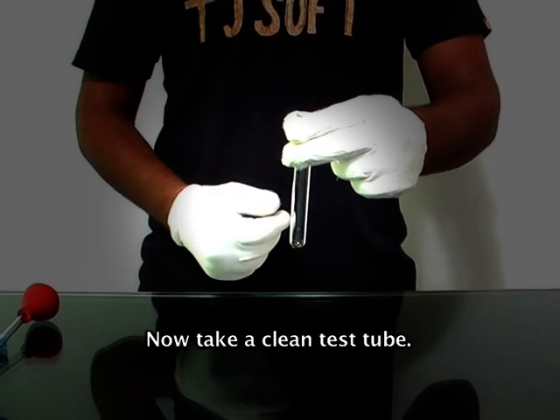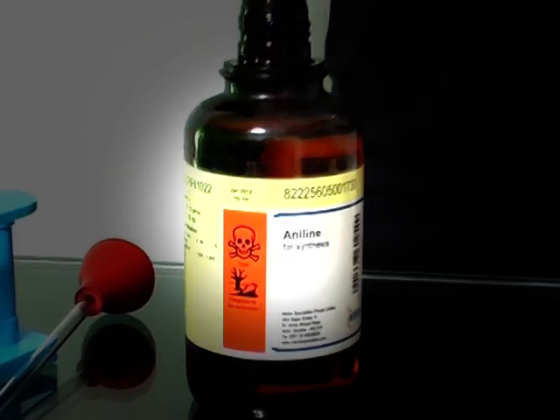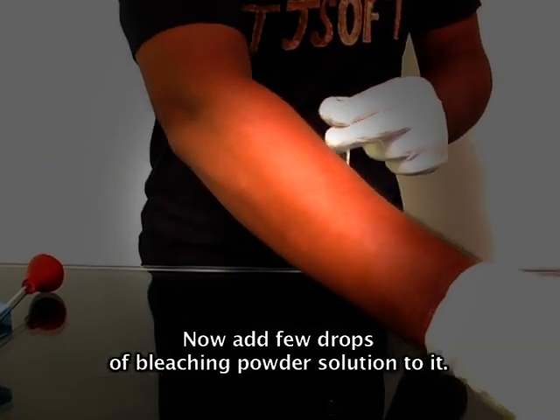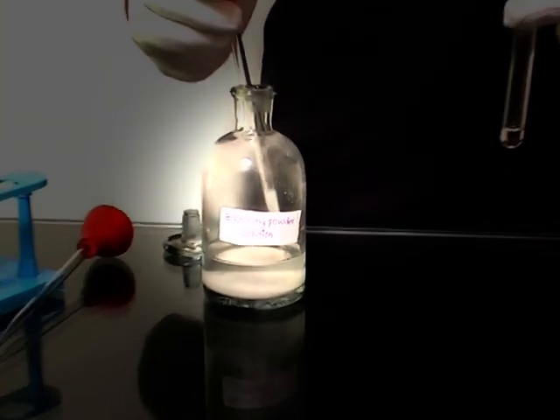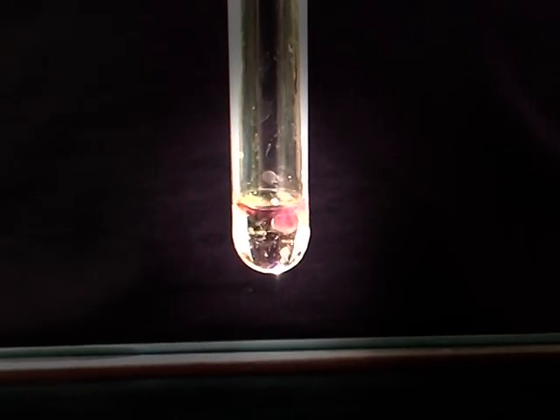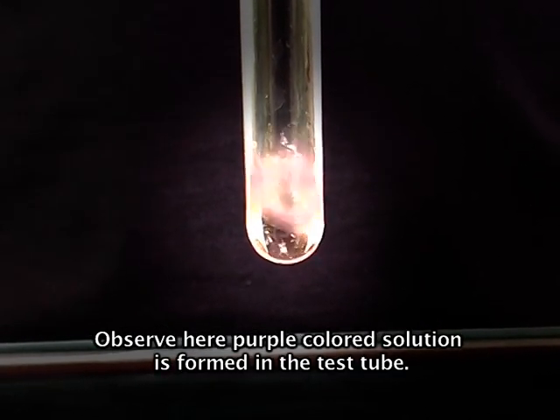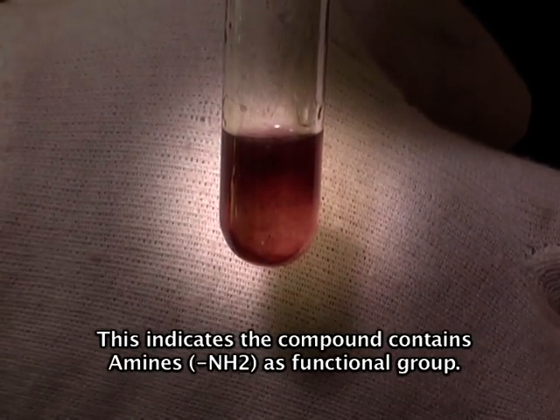Now take a clean test tube. With the help of a pipette, add 1 ml of aniline solution. Now add a few drops of bleaching powder solution to it. Observe here — a purple colored solution is formed in the test tube. It gradually changes to brown. This indicates the compound contains amines as the functional group.